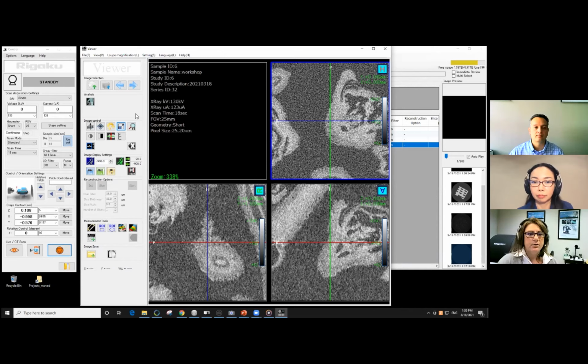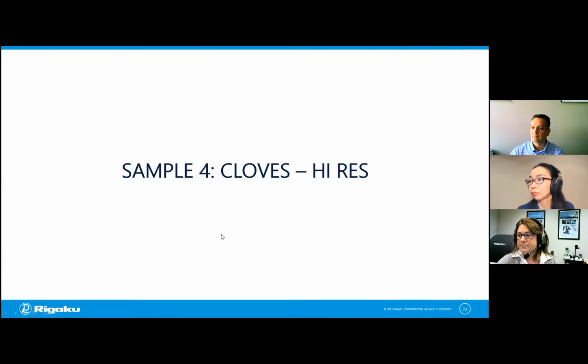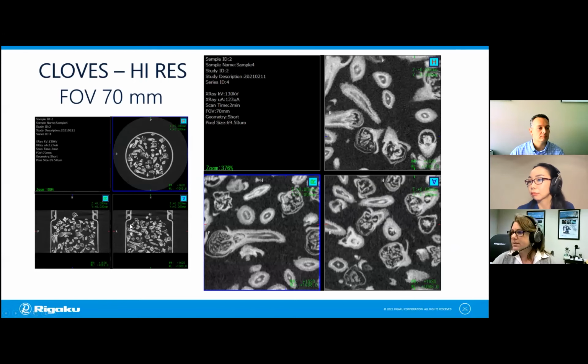All right, so you can see here that you guys have chosen the correct answer again. You all get A's. Let's see what happens if you would have chosen a different setting. Okay, so this is the setting with 70 millimeters. We can see things inside, but it's quite blurry. So this is what the 70 millimeter full field of view is, and this is it zoomed in.